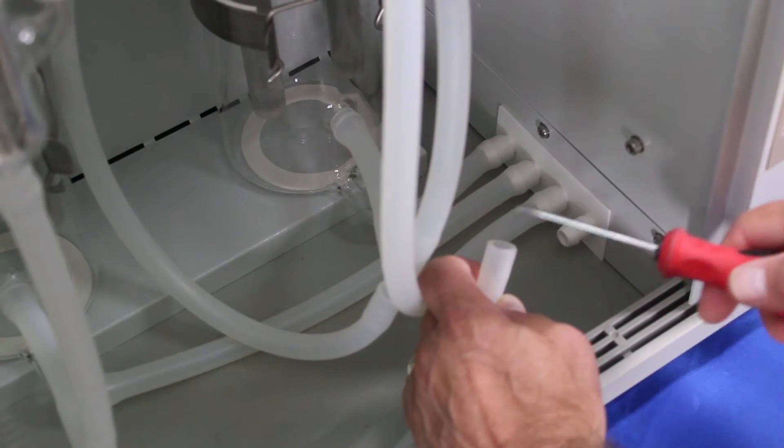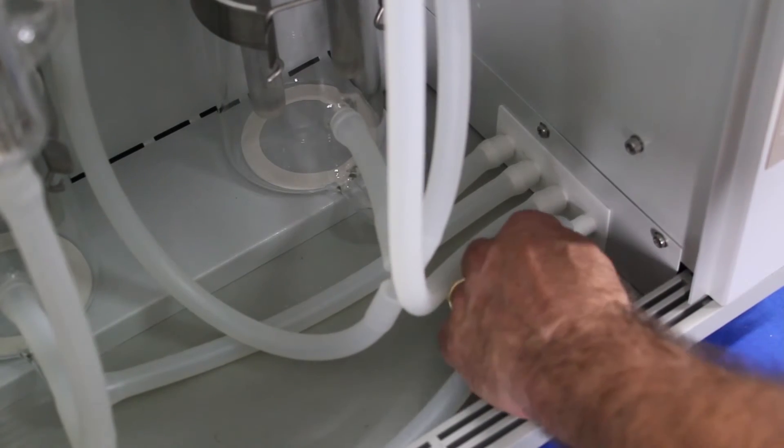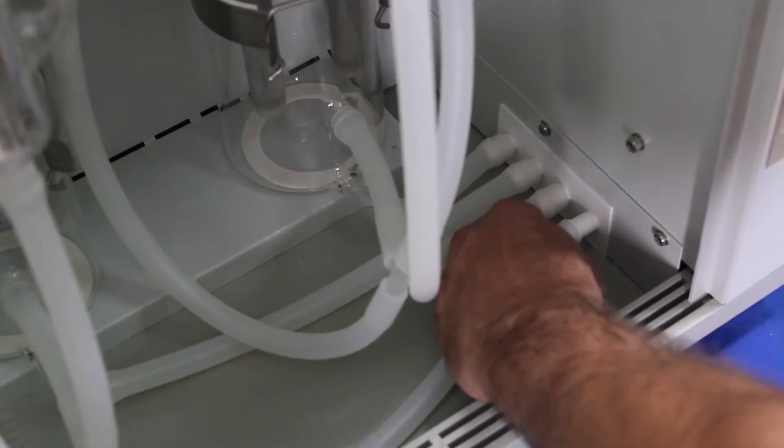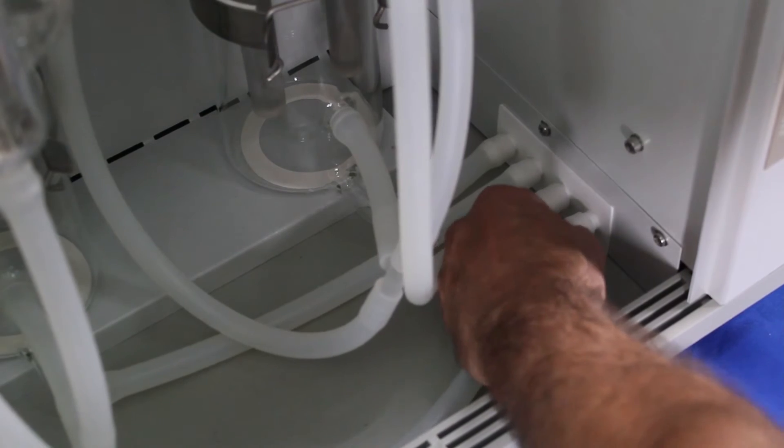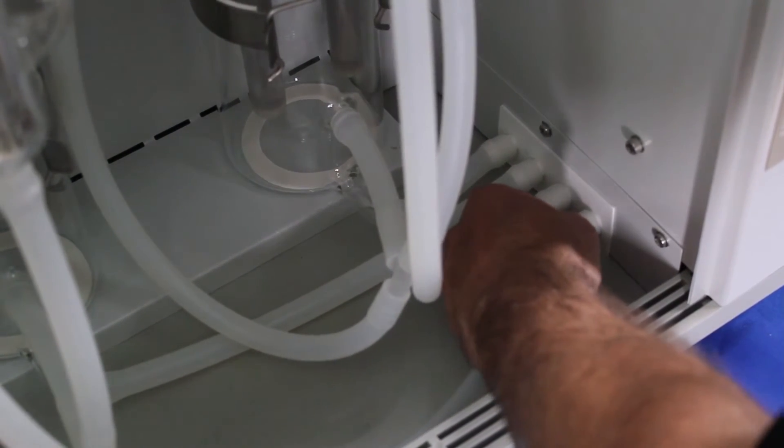Then when you go ahead and reinstall it, put a little bit of water on here, put that back on there, and slide that all the way back so it's all the way to the back.